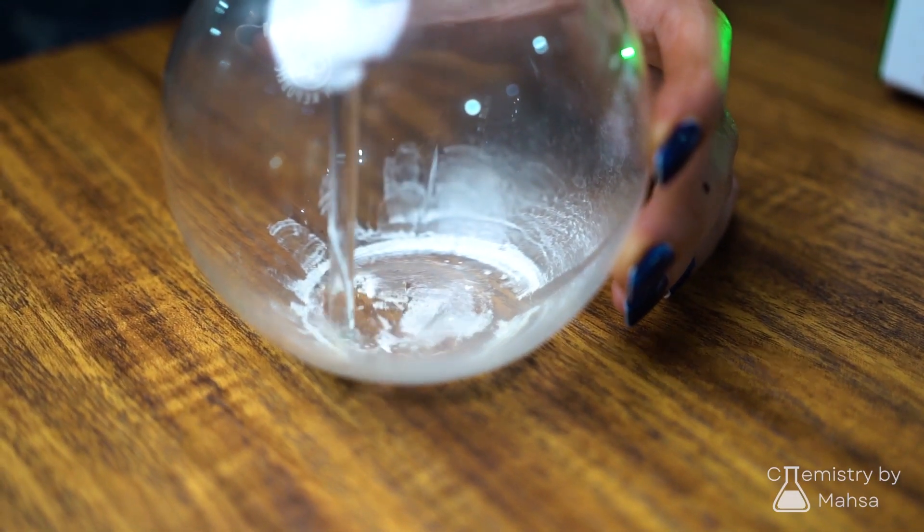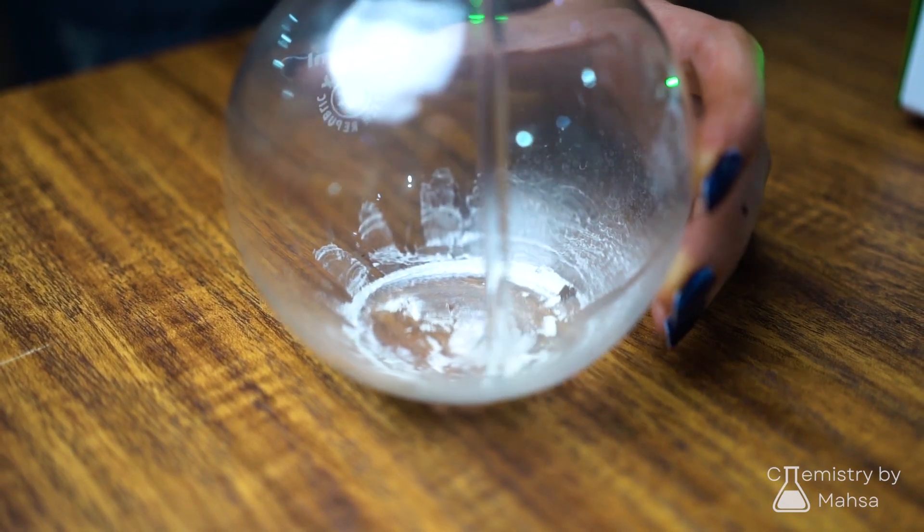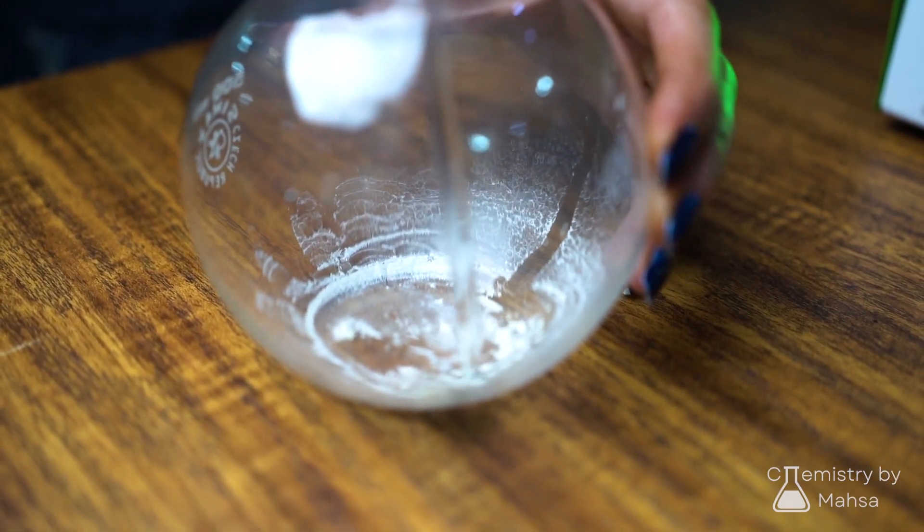I was reading an article about extracting caffeine using different extraction methods and I was tempted to see if I could perform it and observe how caffeine powder actually looks like.